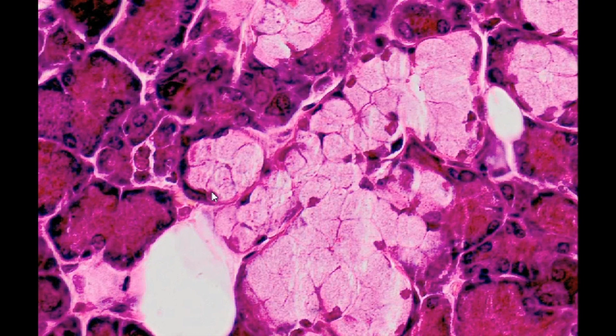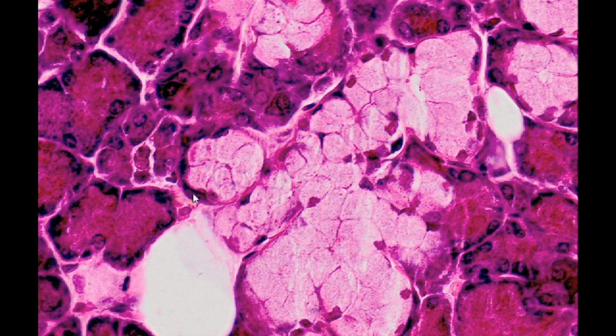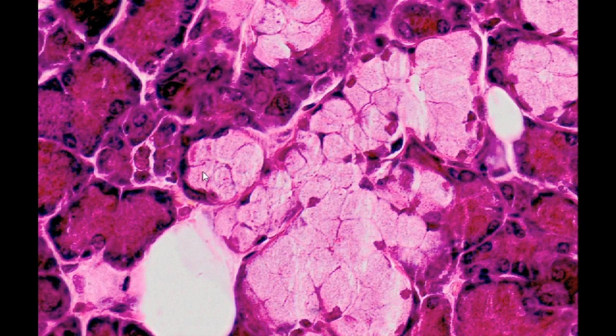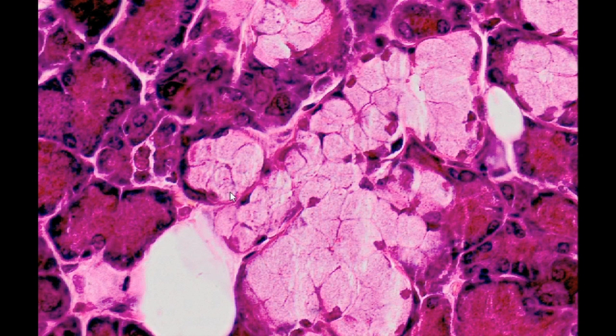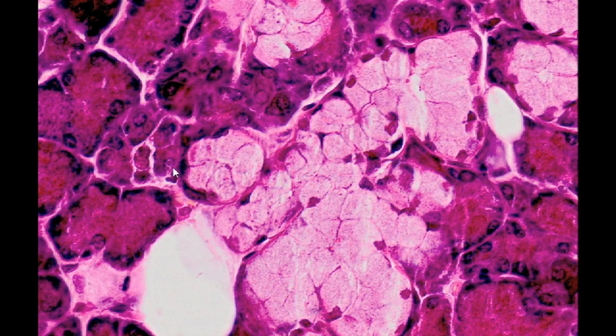The nuclei of the mucus cells are flat, located at the basement membrane, and the mucigen granules they contain make these cells appear very bright.